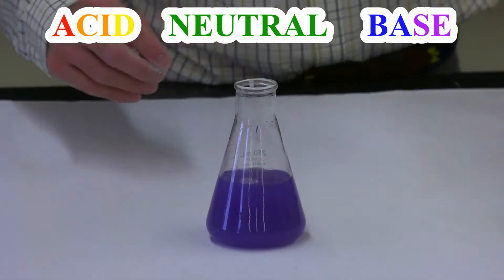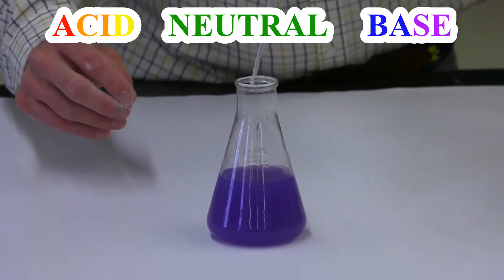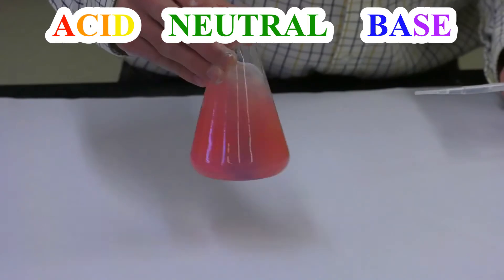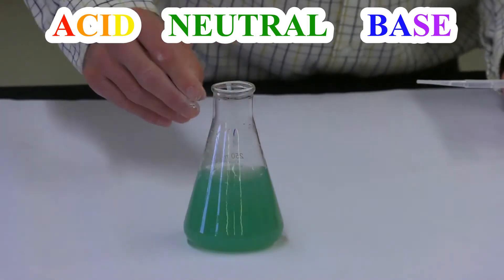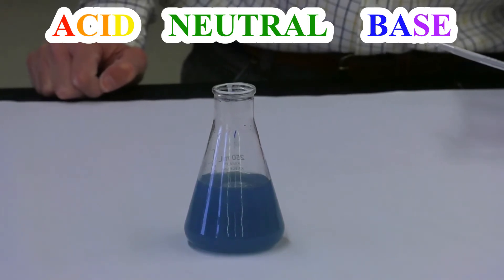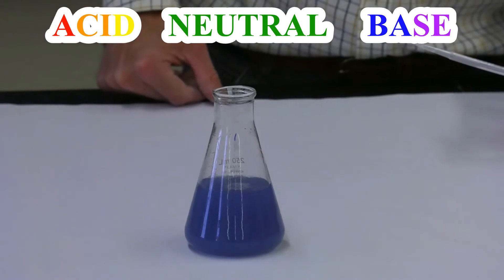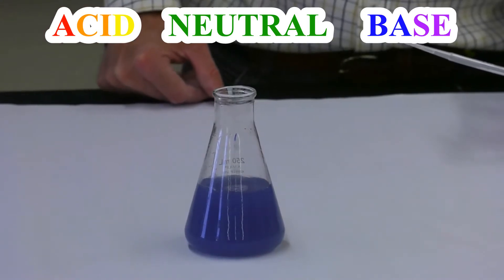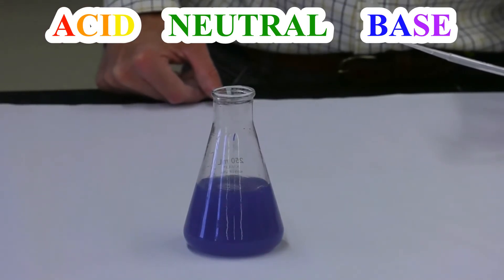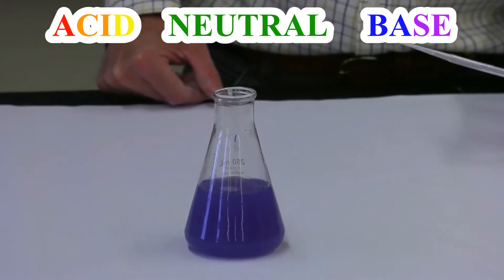Something's going on there. Let me add another drop — I'm going to add two drops this time. Red, orange, yellow, green — that went really fast. Looking kind of blue or aqua-ish colored right now. What in the world is going on? It's getting a little darker blue, even getting back to violet, isn't it? Sure is.